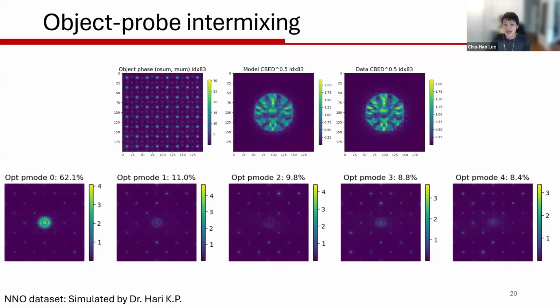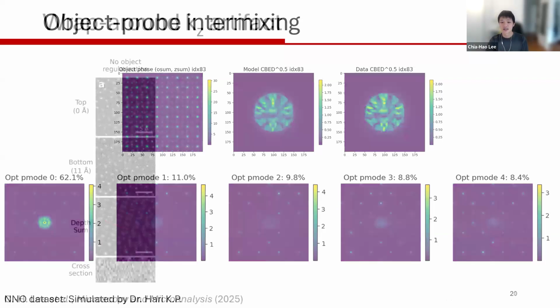Secondly, I intentionally start from an incorrect probe defocus value. This data set is actually simulated at focus, but when we do the reconstruction, I intentionally change it to something like 10 nanometers over focus. You can start seeing that if you start from a very off initial condition, you may end up getting a lot more artifacts than you initially expected. So this is one type of object probe intermixing. There are other types, especially in k-space, but I don't think I have an example here for today.